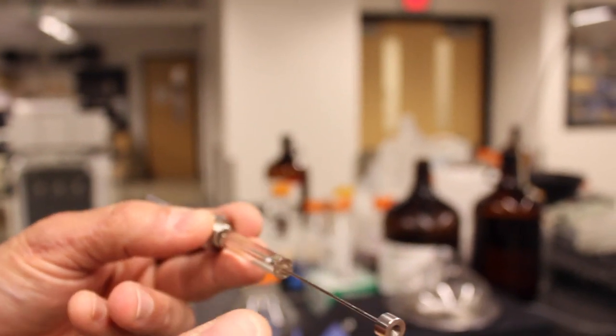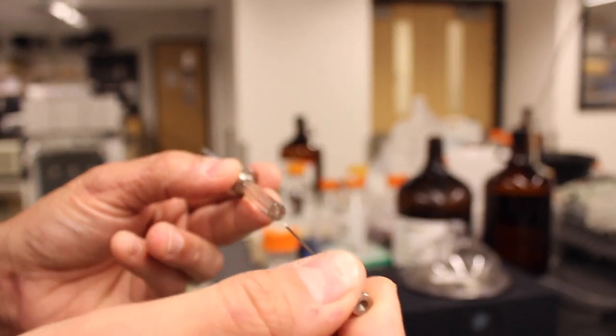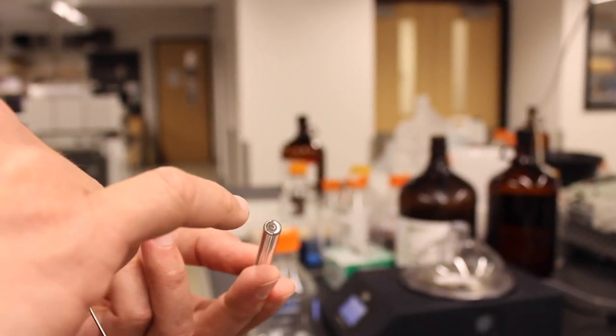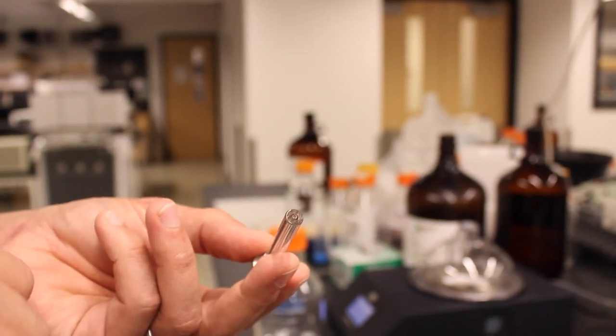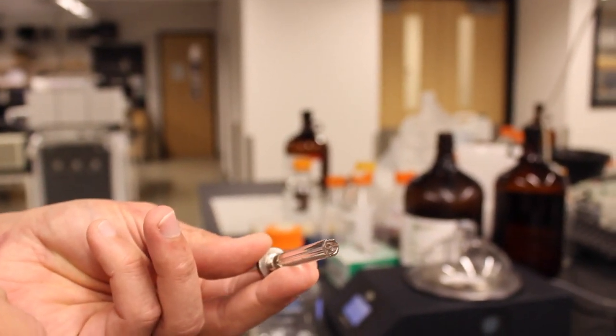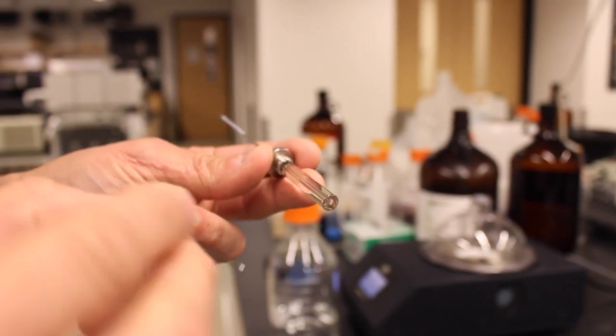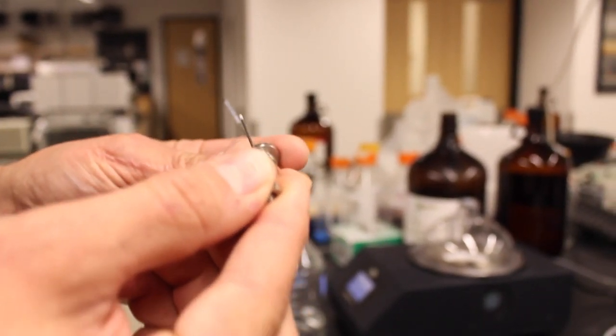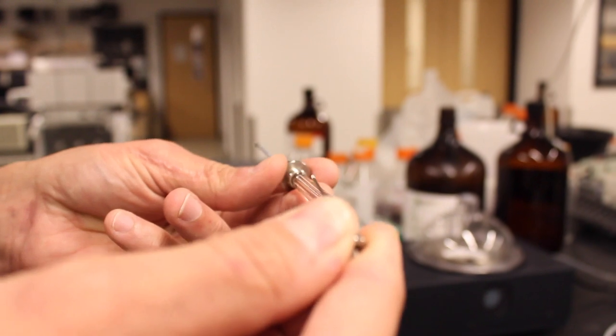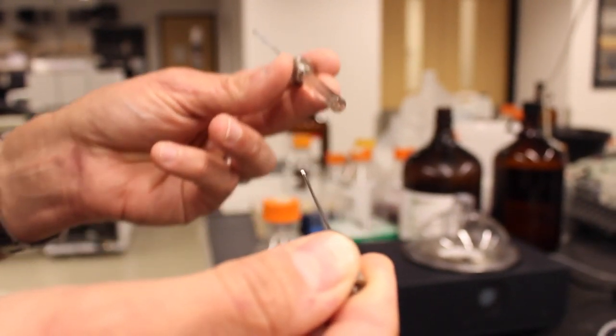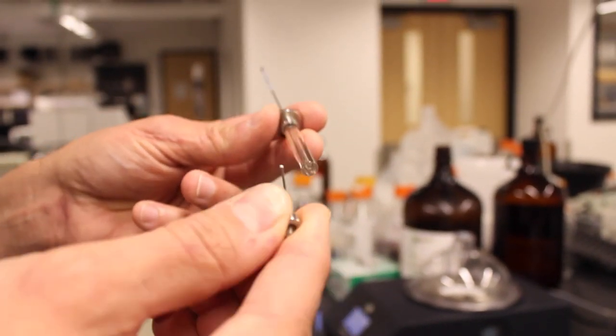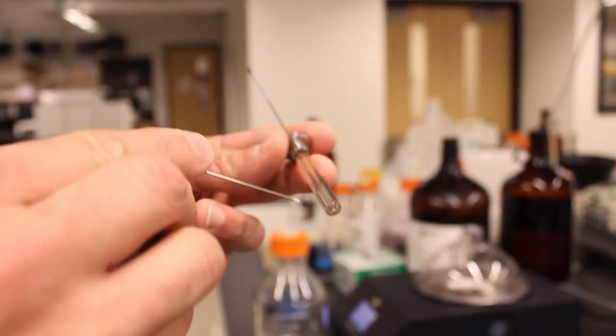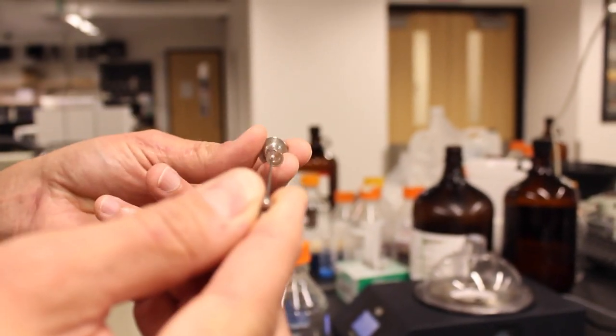There are several ways that this can be done. One way that is possible to do this is to use a pipette and fill the syringe from the top. I'm not going to be discussing that. An alternative way is to use the syringe itself and suck up liquid and then use gravity to help assist filling the rest of the syringe and I'll demonstrate that technique.